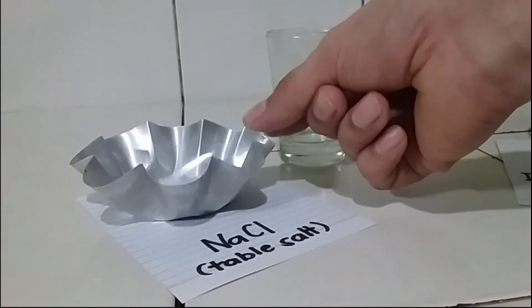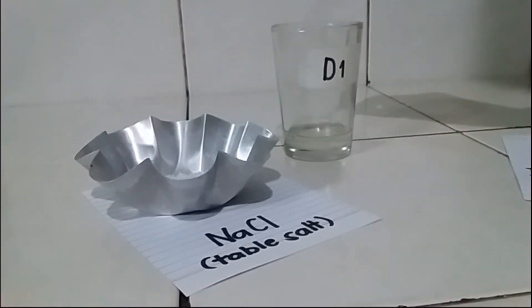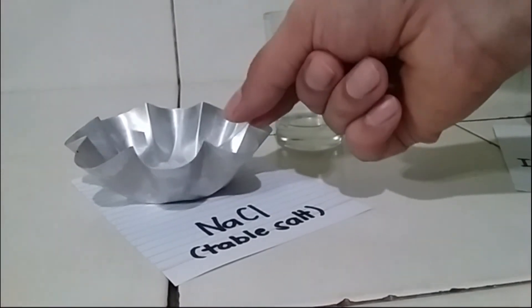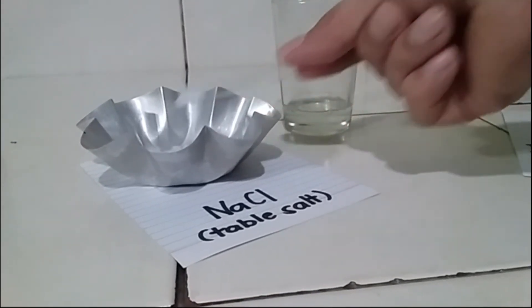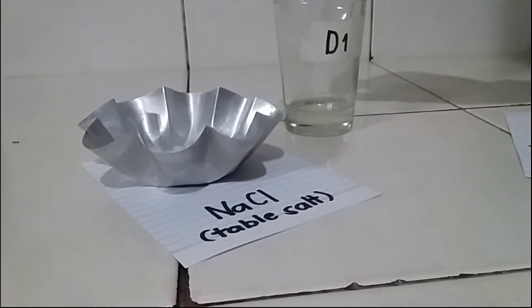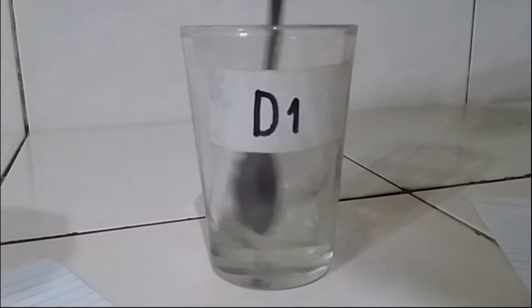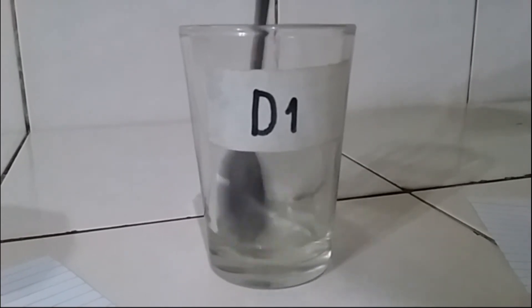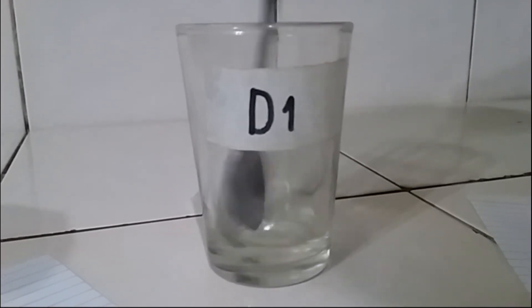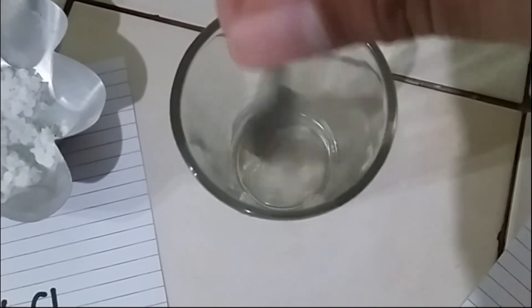Using table salt in protein denaturation, it affects or alters the salt bridges of the stabilization unit — the ionic interactions between the opposite charges of amino acids on the protein surface — which, as you can see, produces a white precipitate that formed in the solution.